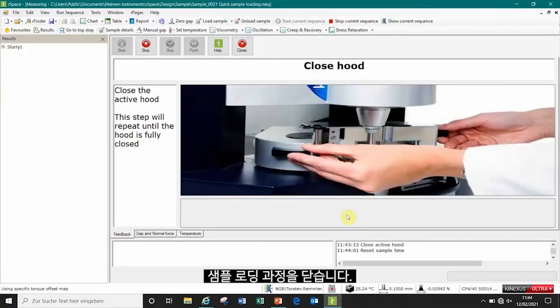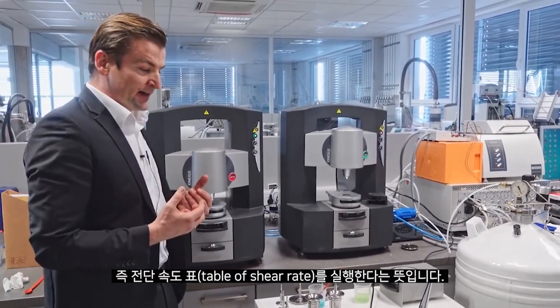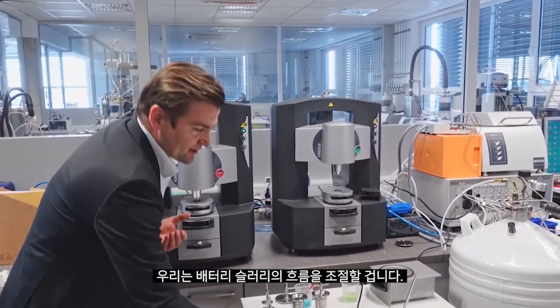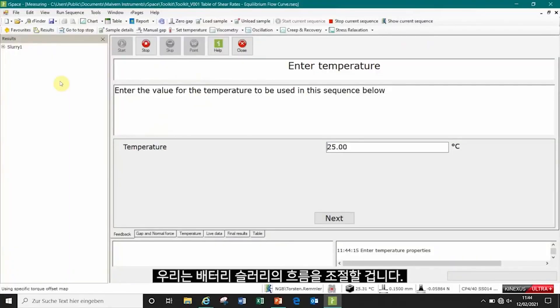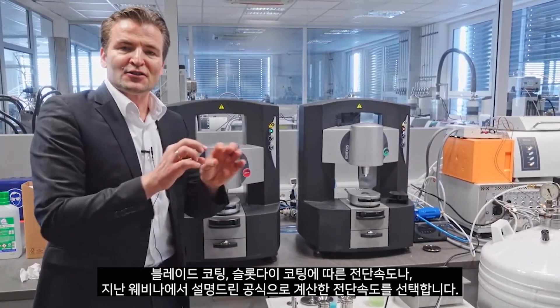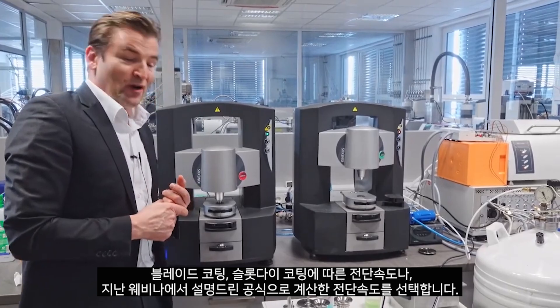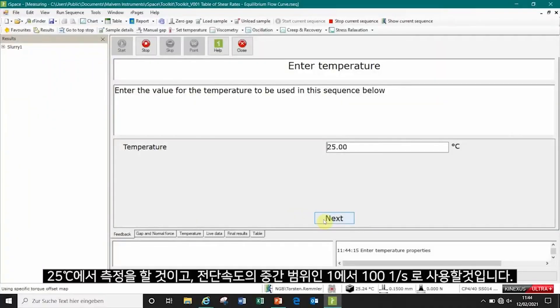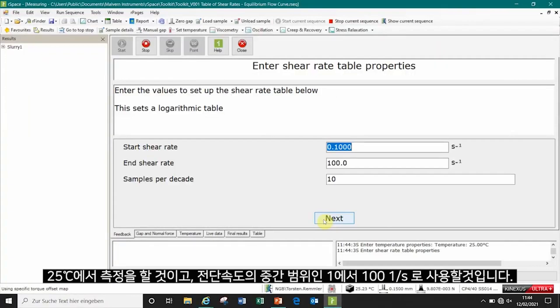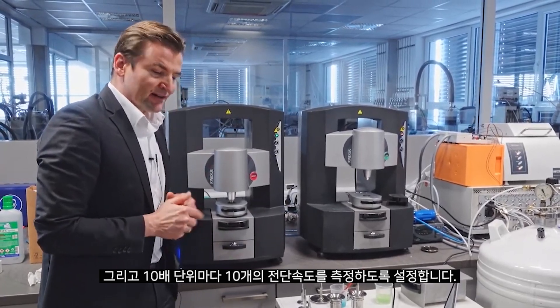We close our loading procedure and now we can start the test. I would like to do this as a steady state flow curve, meaning we run a table of shear rates. We control the speed of the flow of our battery slurry and choose the shear rates according to the process — blade coating, slot die coating — and we can calculate these shear rates according to the formulas given in part one of this webinar. I will measure at 25 degrees C using a mid-range of shear rates from 1 to 100 reciprocal seconds, typically for blade coating, with 10 steps of shear rate per decade.